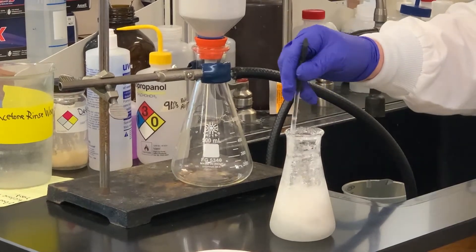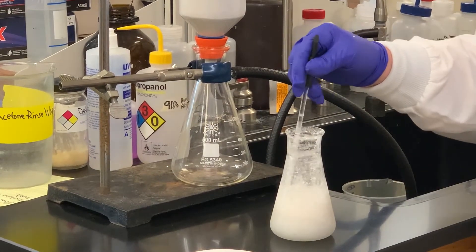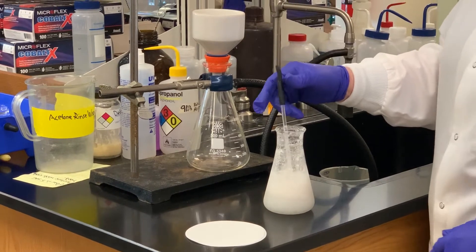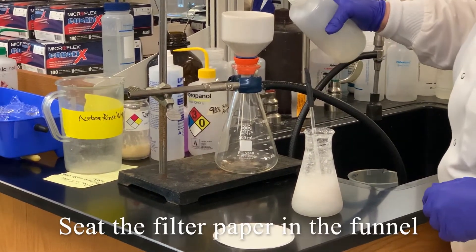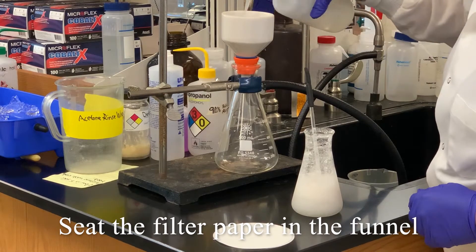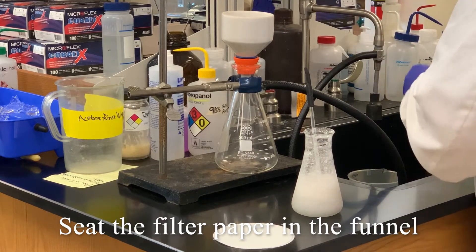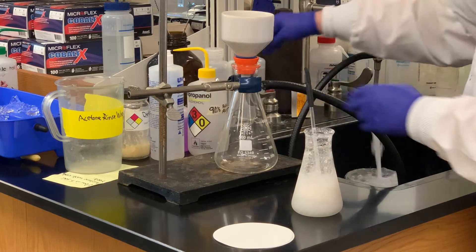Here's our sample that we've just cooled down to five degrees and you can see we've got solid there. So I'm going to wet the filter paper with some water first, and then turn on the faucet. Hose is already hooked up.